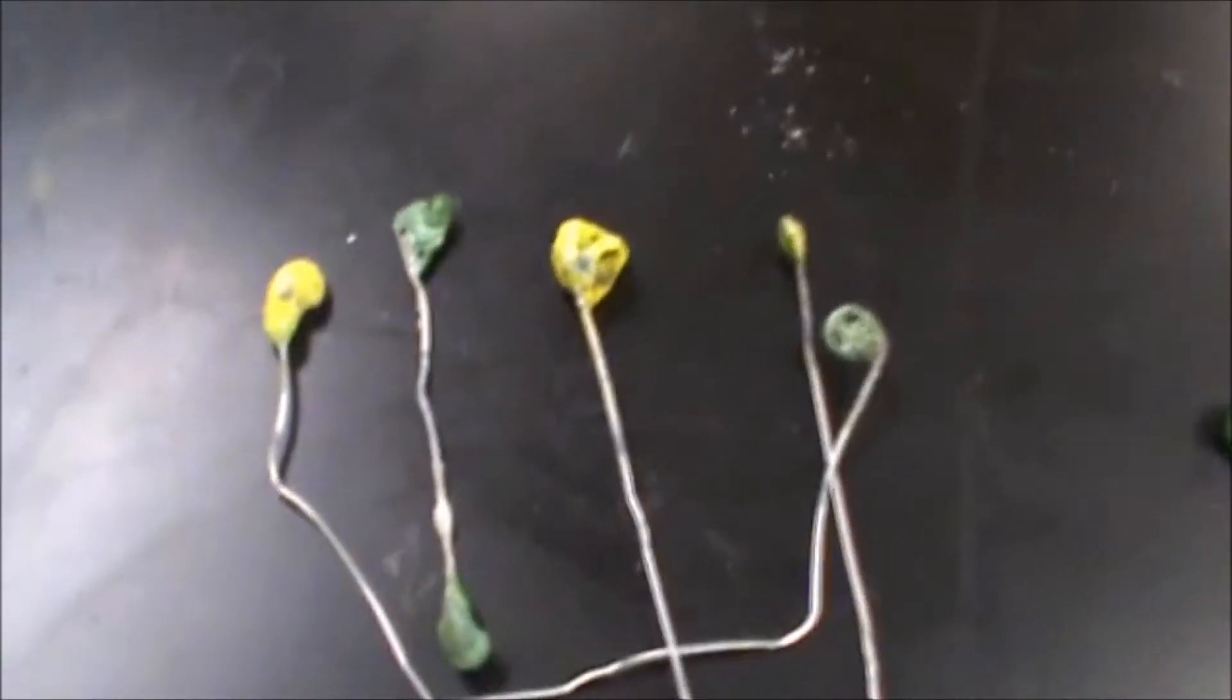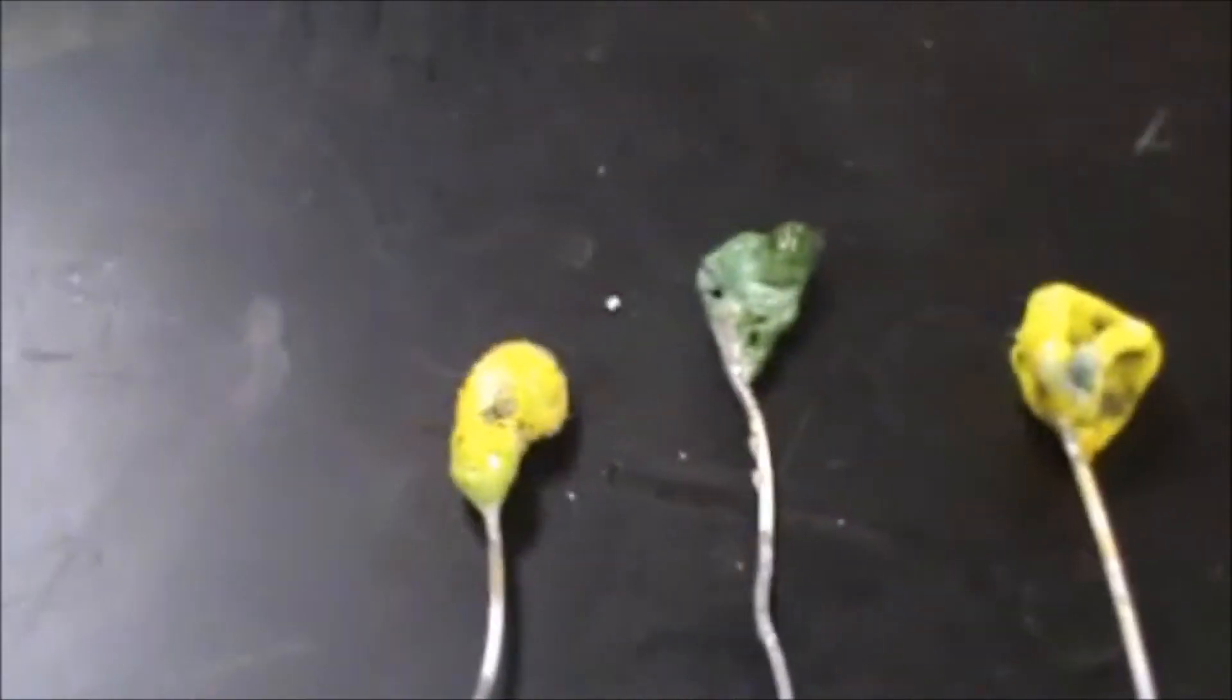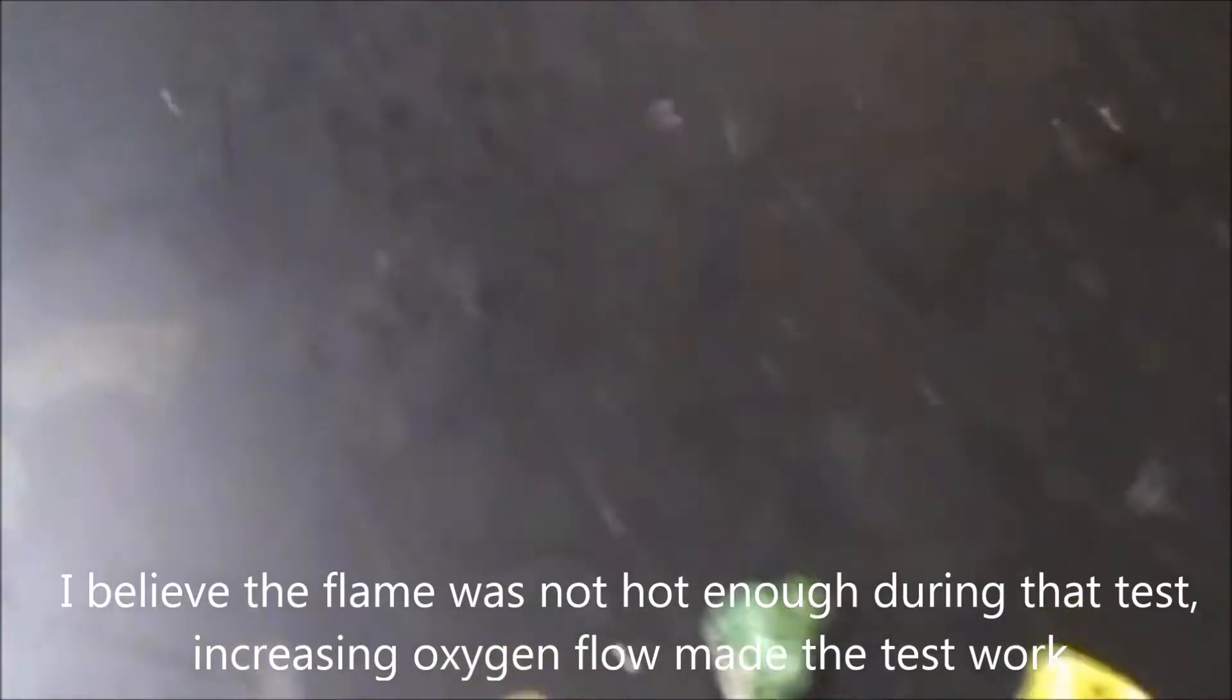This is how you're going to run the chromium test. Here you can see a couple of successful chromium tests. Also one that was with chromium but not successfully run.